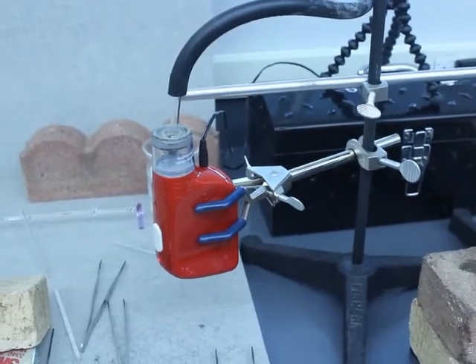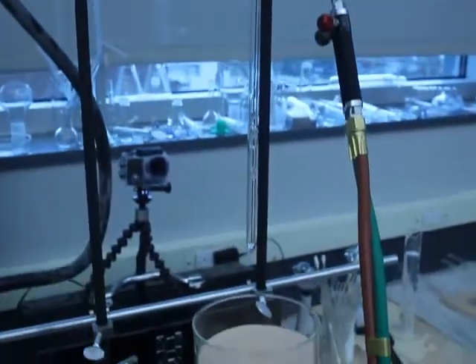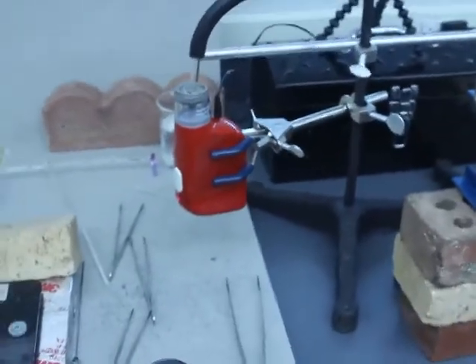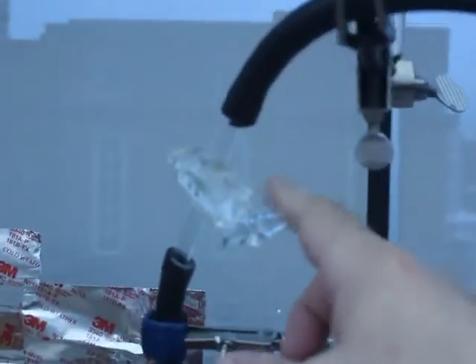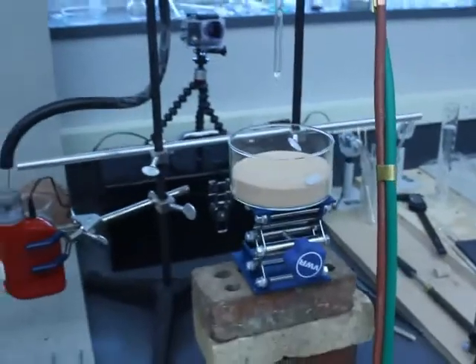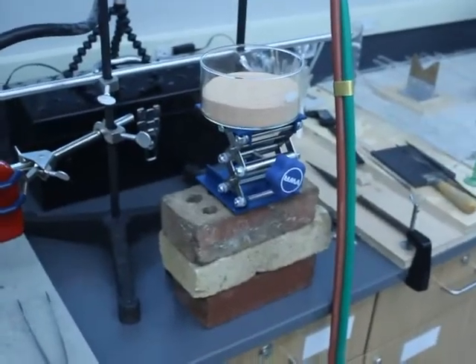And to show the details of the apparatus that I'm using, I'll give just an overview. This little vacuum pump, this is the type that's used for sealing sandwich bags, it has a vacuum hose. It comes up to a stopcock, which gives me some control so I can basically close it. This hose comes down, and that's where it connects to the glass tube that I'm sealing. And I have it drop into this little sand pit. But nothing very complex.